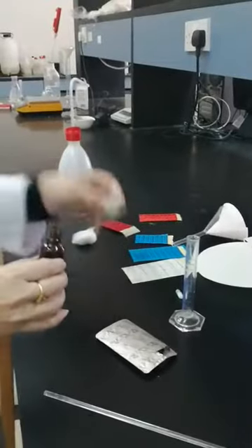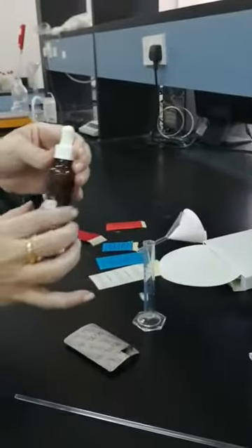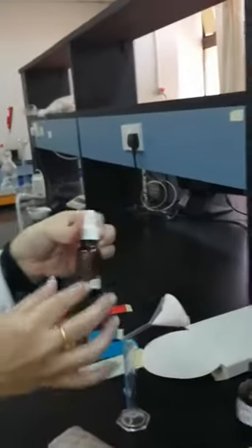I'm going to do labeling. So that label has to really stick to that bottle. That bottle really must be fluted, but we don't have flutes here. We have two types of label: the main label, which is stuck on one side, and auxiliary labels, which stick on the second side. The main label, all the labels, must be written in red print because it is for external use. The main label contains a large part consisting of the name of the patient and the prescription code number and the date. The date must be the date of preparation.